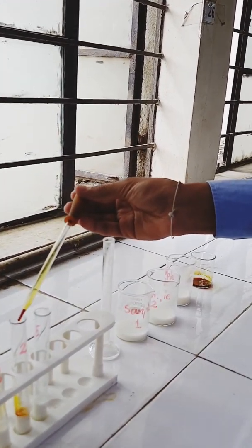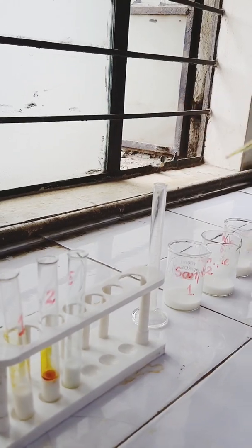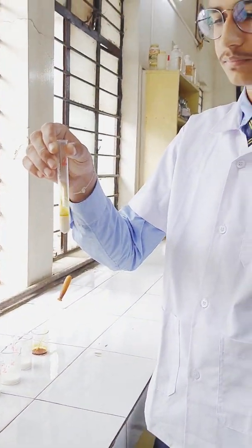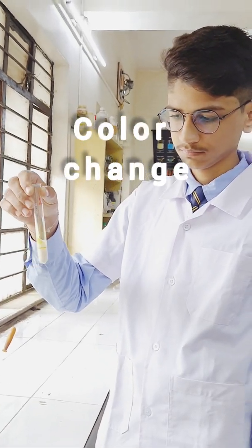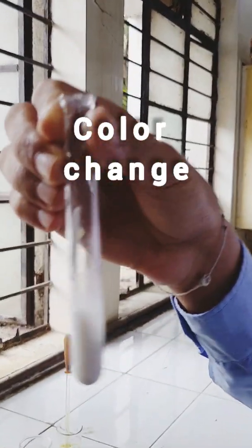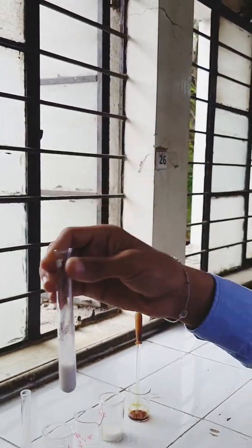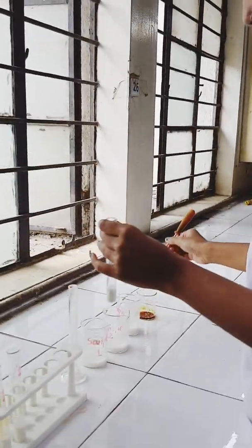Now, take the second test tube. Add iodine drops and mix it well. Here, this sample shows a blueish color after adding iodine drops. It means this sample is adulterated with starch.